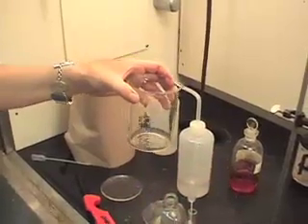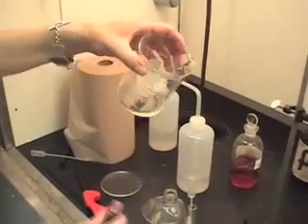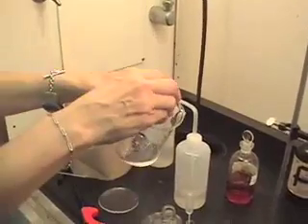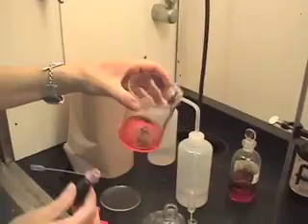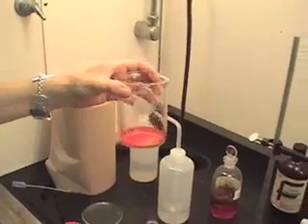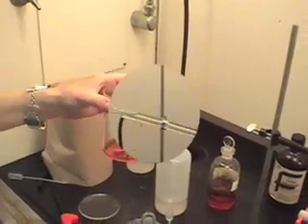Now I'm adding a little bit of red food coloring to it. It too is soluble in this, and now I have a clear red mixture.